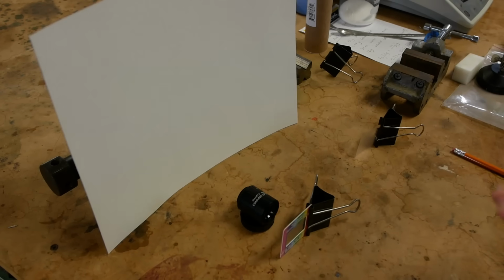The trick is, how do we put all this together computationally? That's why it took quite a while to come up with this technique and make it work. It's not so trivial to capture all those images with all the different spatial information that they contain and put them together into one final output image.